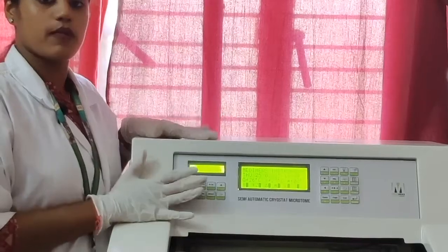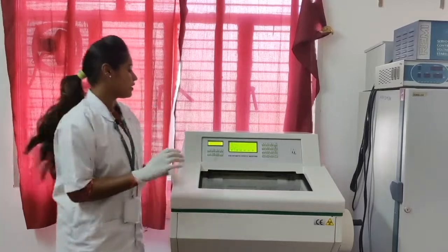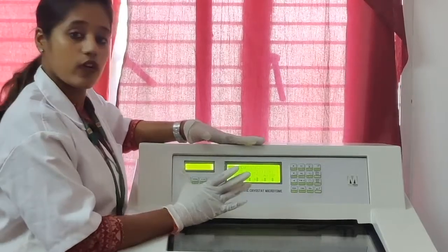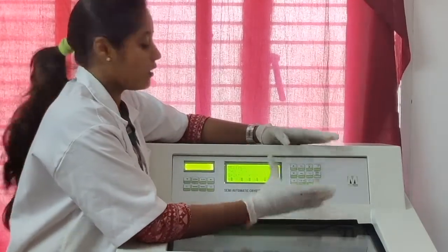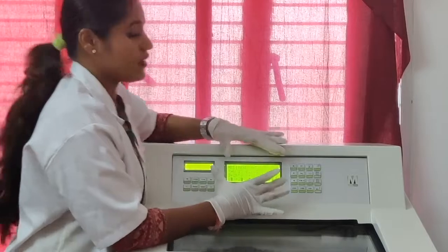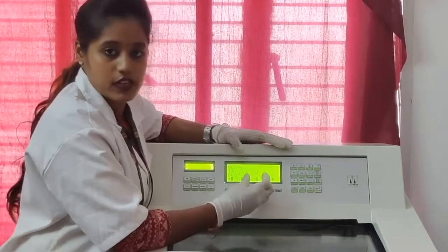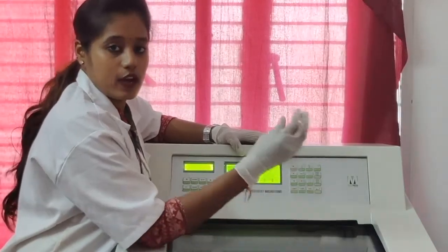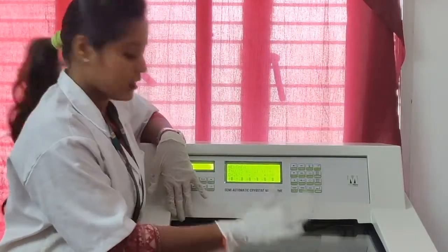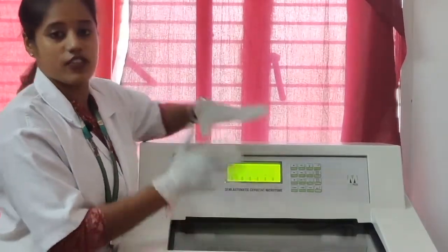So this is the control chamber, this is the freezing chamber and this is the refrigerated chamber. At first the control panel: on the right side it consists of the experimental keys and on the left it consists of the microtome keys. In between there is the LCD display where you can see the adjusted temperatures of both the compressors and also the freezing time of the chamber.